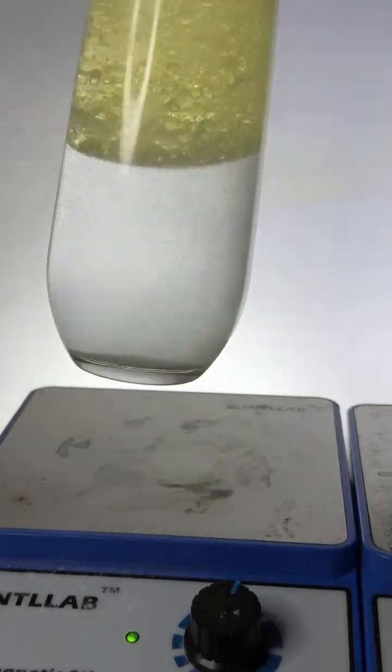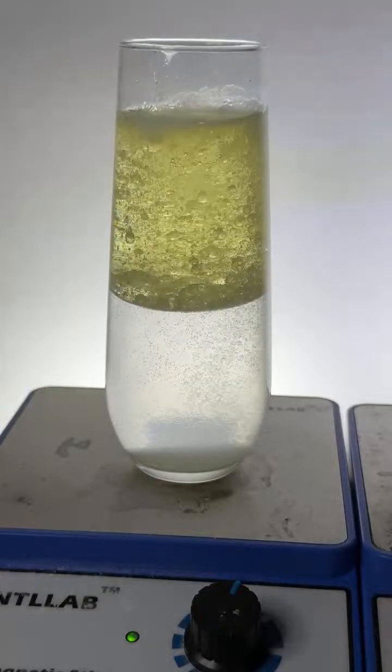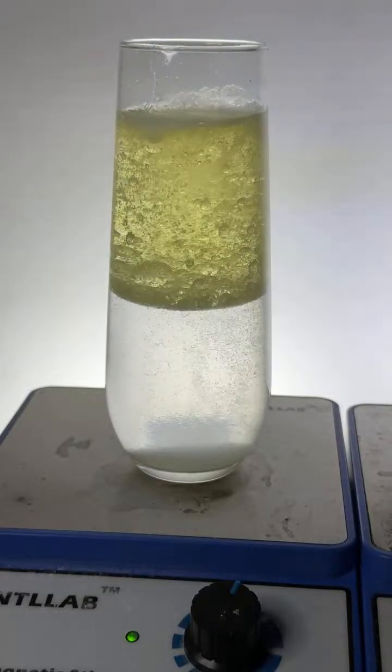I think we're done, huh? I think it's all done. Let's pop another one in there, huh? I got another one. Let's pop it in there, see what happens.